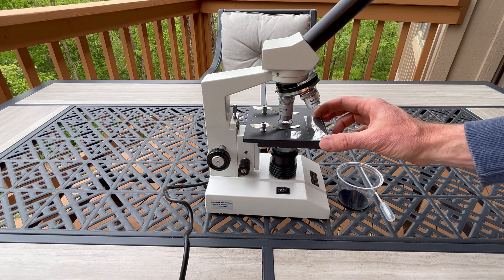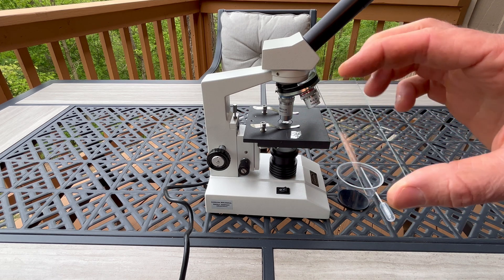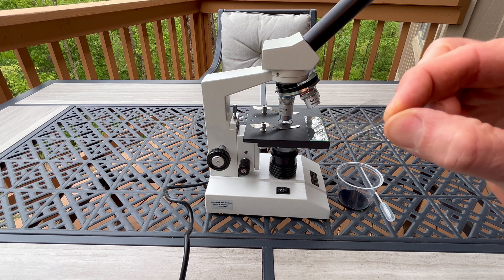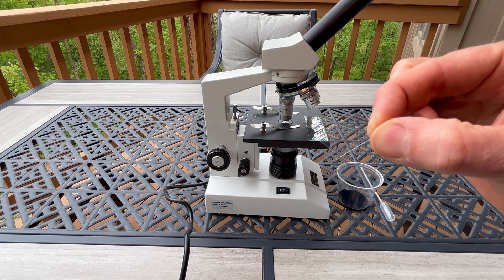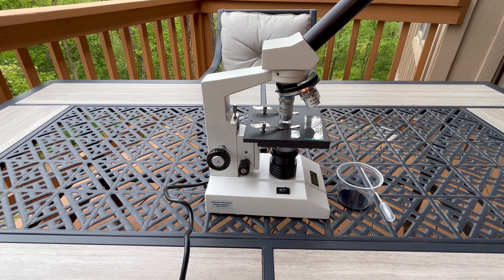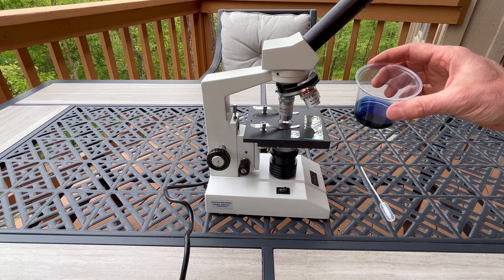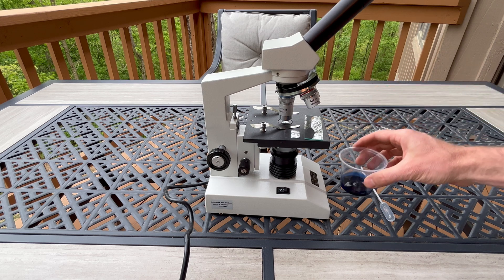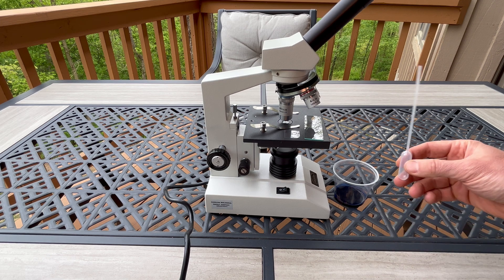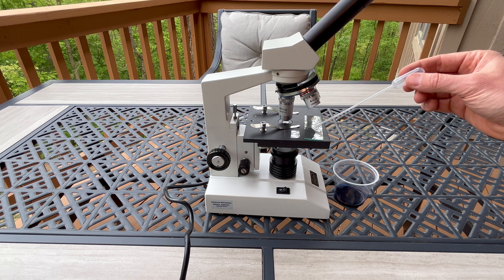In order to see my human cheek cells, I'm going to need a slide — the rectangular piece of glass — and a cover slip, which is the small, very thin square piece of glass. Be careful with these because they are glass and fragile. I'm also going to need some methylene blue, because the human cheek cells are kind of transparent and dyeing them blue will make them easier to see. I'll use a pipette to apply a few drops of methylene blue to the middle of the slide.